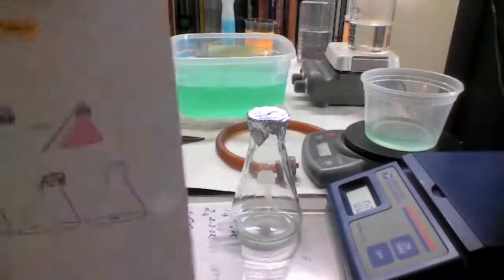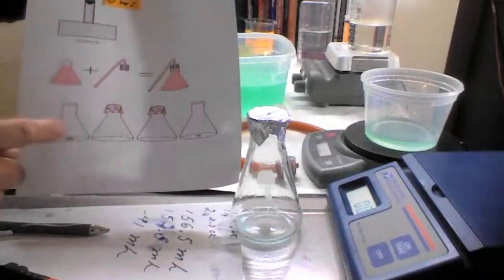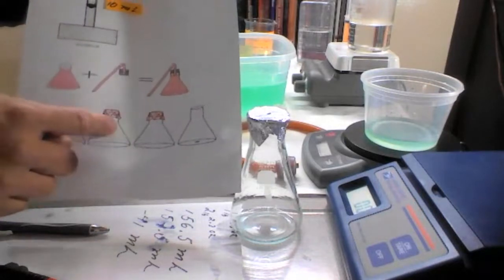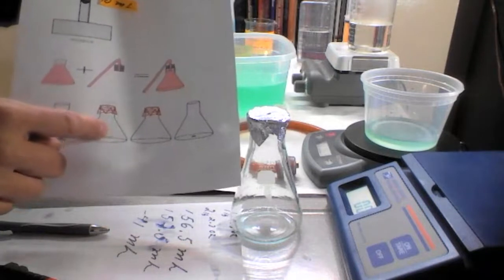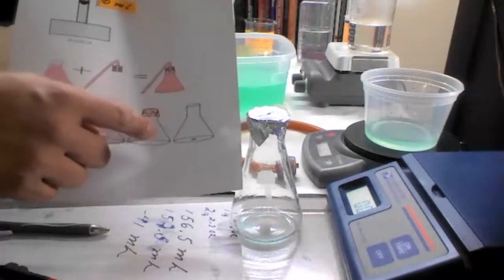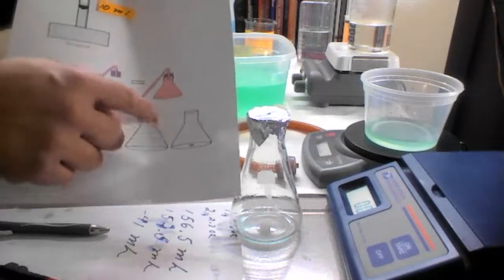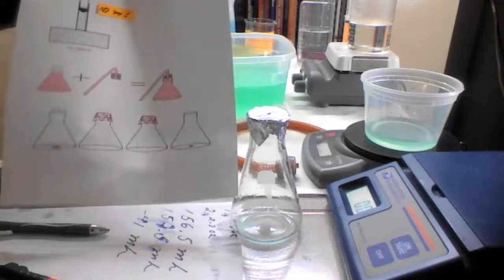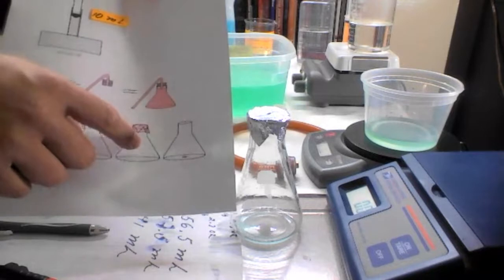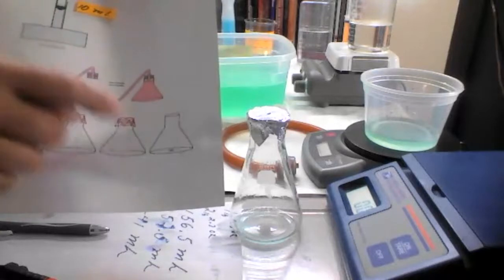So this is what is going to happen. We put some liquid in there. The liquid is going to vaporize. The pressure is going to go up inside the container. Some of the molecules are going to get out, and when the pressure inside the container is equal to the barometric pressure, the outside pressure, then we are going to have an equilibrium system. Then we cool this down, and whatever remains here is the number of molecules that were here at the temperature of the flask at 1 atmosphere of pressure.